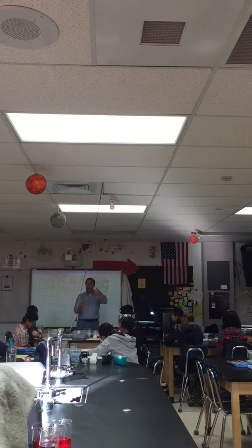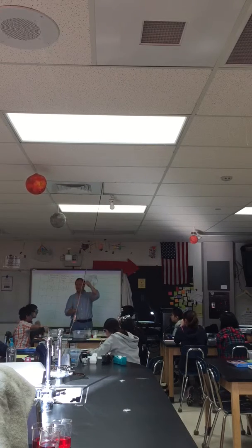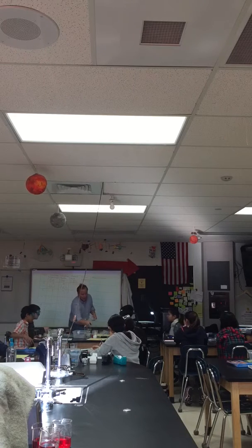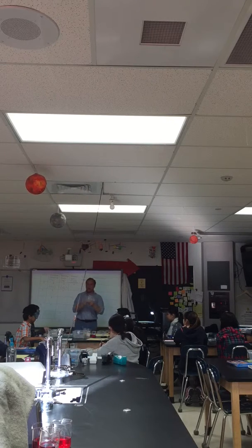Just watch me. I'm going to take this, spin it, twist it off. Okay? I'm going to take the baking soda and do the same thing. You're going to put a lot more, 15 grams. Put it in the other corner. You're going to need 2 hands to do this, both you and your partner. And I'm going to twist off this as well. Are you with me?